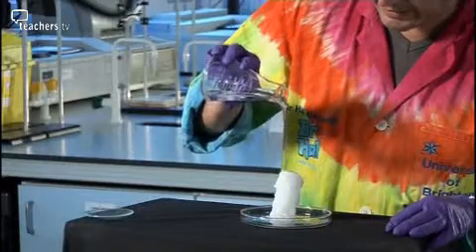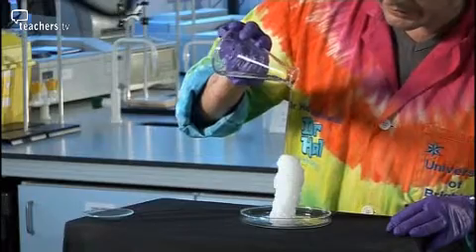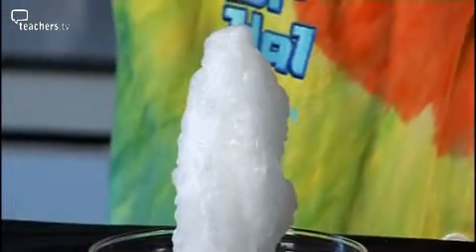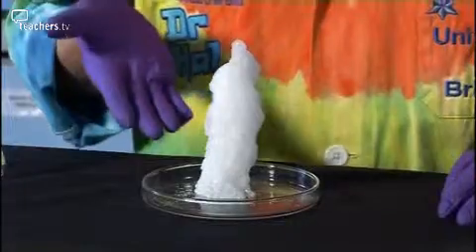It's getting hot. I can feel the heat from here, and this is the basis of hand warmers. Hand warmers are supersaturated reservoirs that give out lots of heat. And there it is.